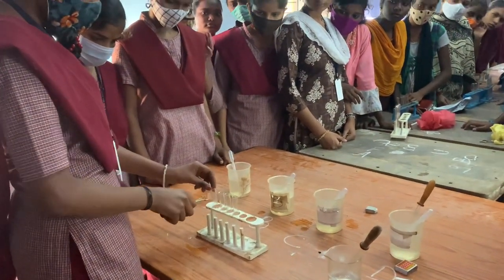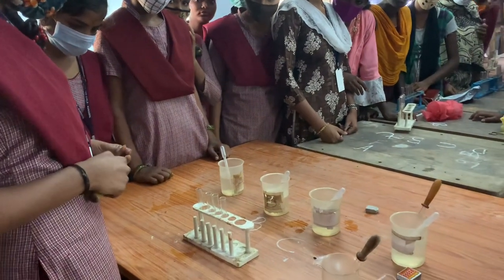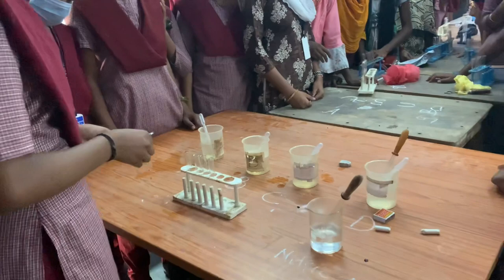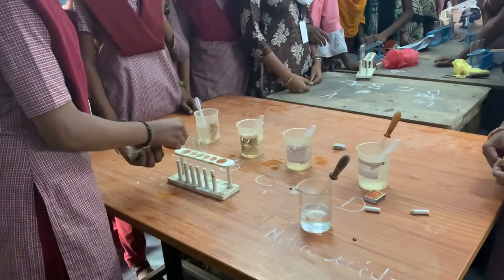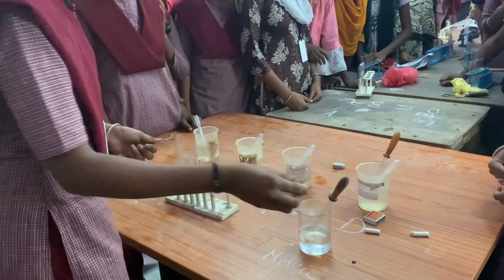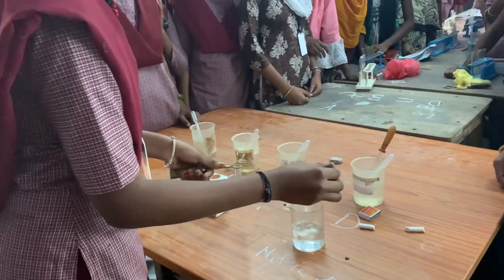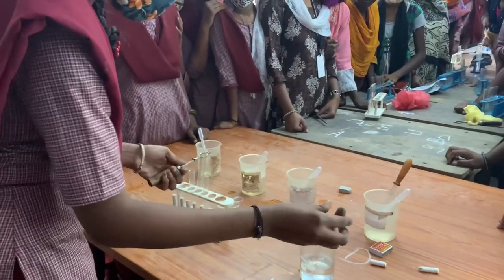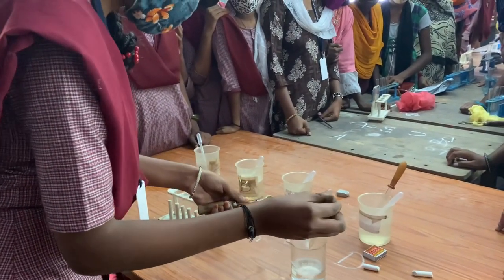In this experiment, we will collect the reagent. We will give you the reagent and the nitric acid. We will give you 4 test tubes and then prepare each test tube.